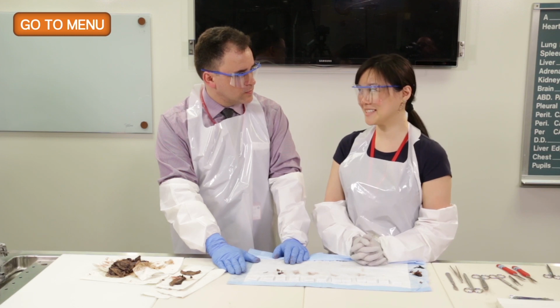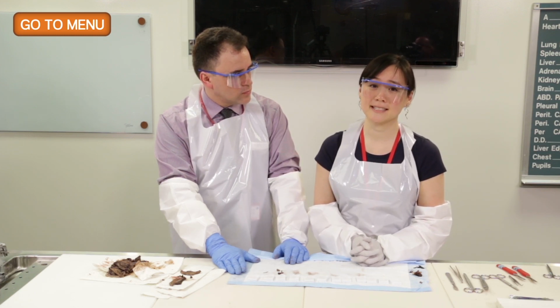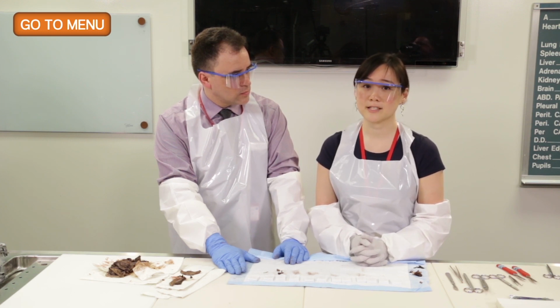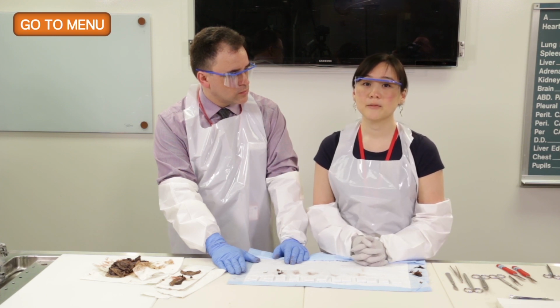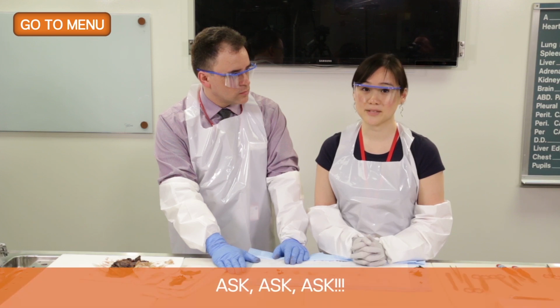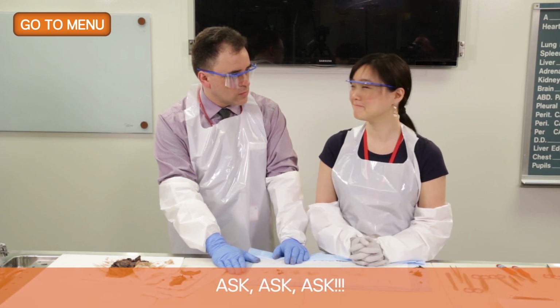Well, just a single one, Dr. Borzuk. Essentially, if you have any questions and if you're confused about how to gross a specimen and for some reason the grossing manual doesn't clearly define how to gross it, feel free to call an upper year resident as well as the attending who's on with you, or any attending, to review the specimen with you.